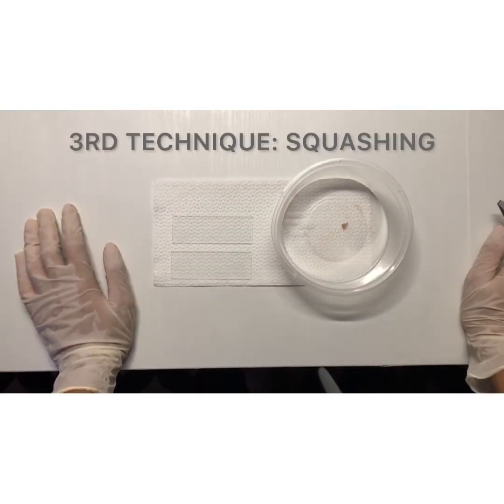So now I will be performing the squashing method of fresh tissue preparation. Squashing preparation can be performed simply by crushing a small piece of tissue between two microscopic slides. And it is important to know that the tissue specimen must be less than a millimeter in diameter.